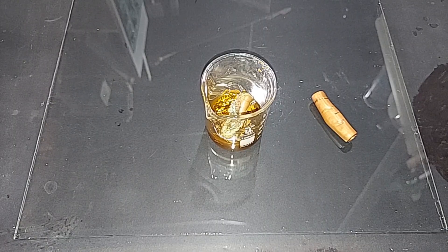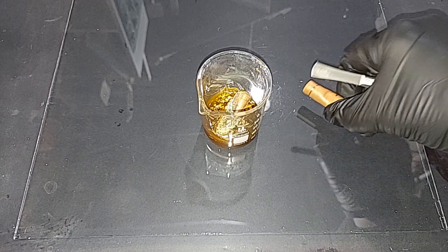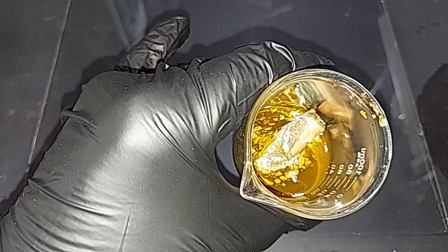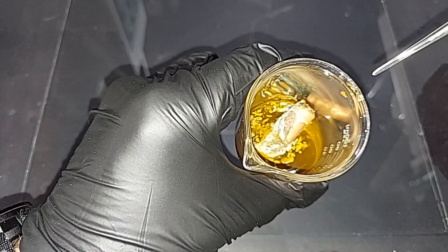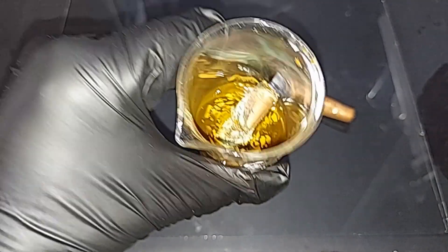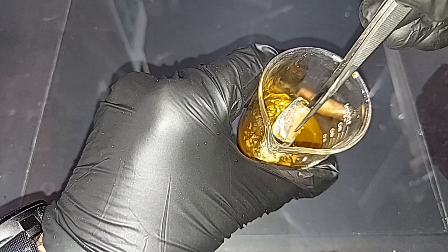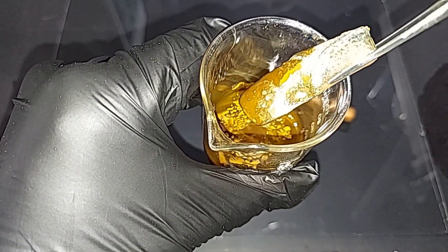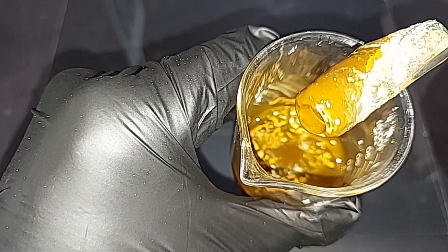From the 100 milliliters of ferric chloride set aside earlier, I poured about 20 milliliters into a small beaker and added a bent piece of copper piping overnight. You can see the result: the white material is copper(I) chloride that has formed and precipitated out; the solution looks muddy and brown from ferrous chloride also produced. Pulling out the copper piece — there's a buildup on the end, and it has eaten into the copper. This is exactly why ferric chloride works so well as an etchant.